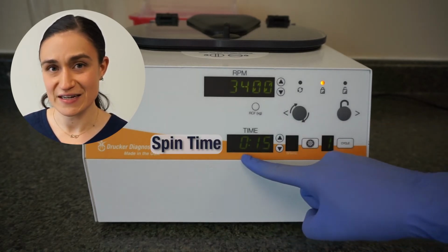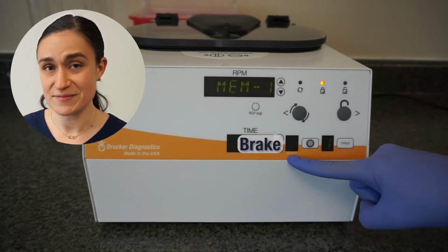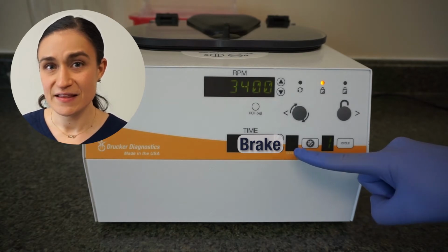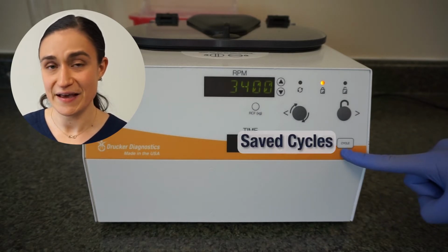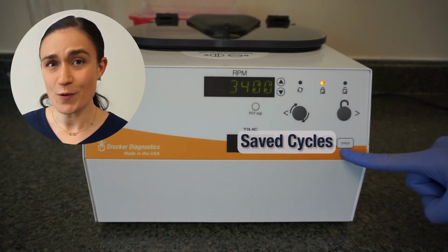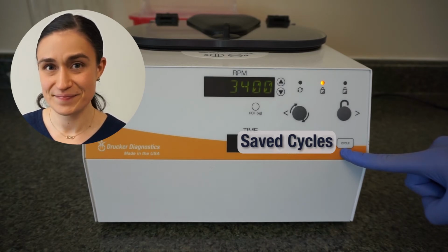The time screen shows my currently selected cycle time. The brake display shows whether or not the brake will engage. The menu button will help me enter the advanced menu. And the cycle button allows me to save a new cycle, switch between currently saved cycles, or will help me edit a currently saved cycle.